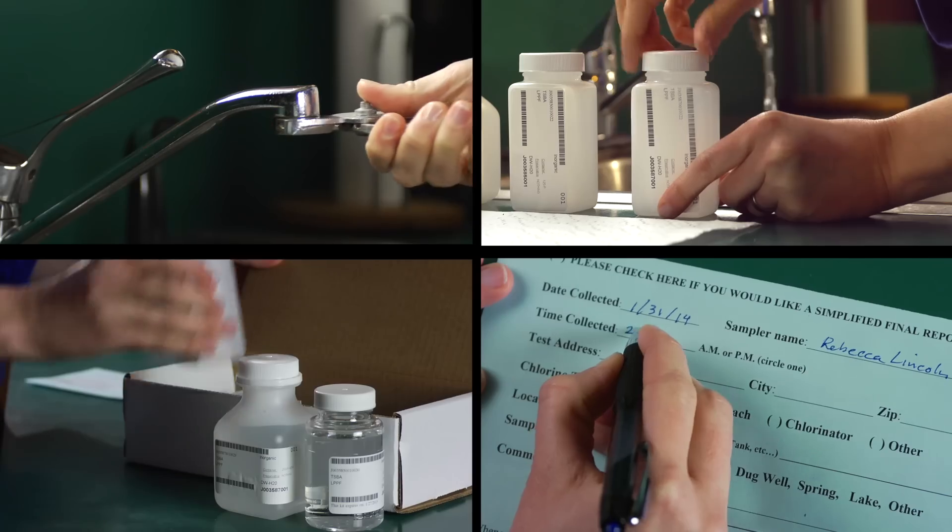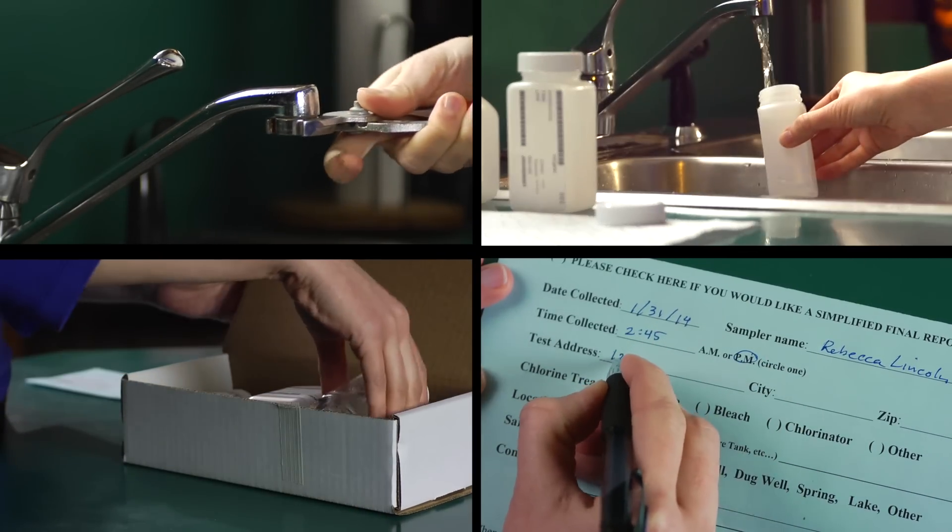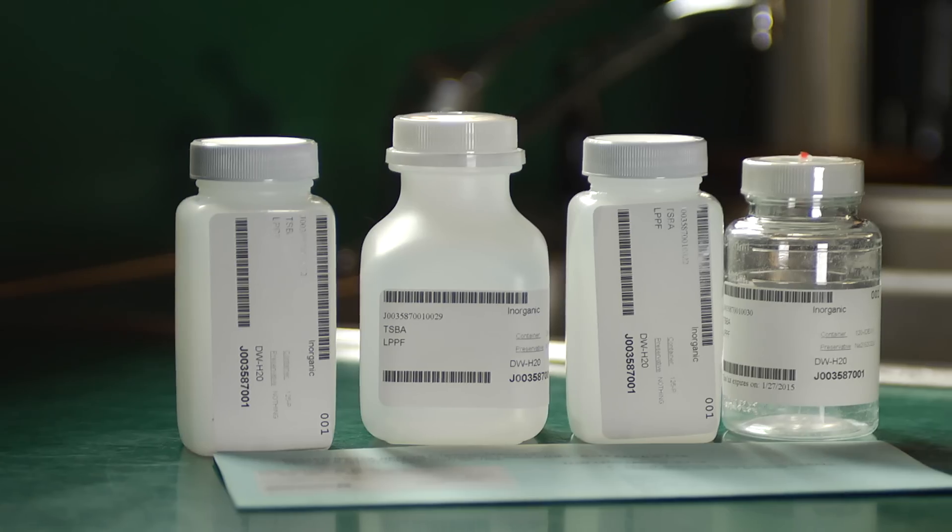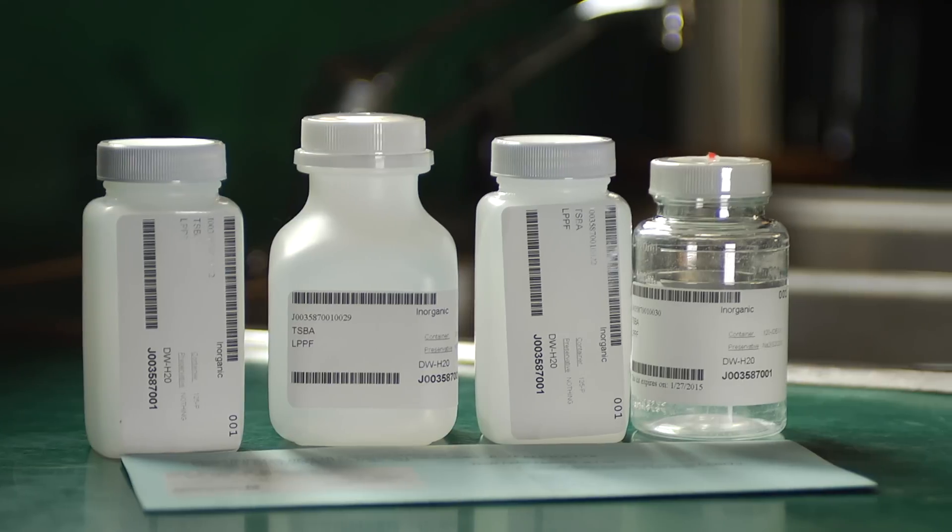This video will show you how to test your water, but be sure to carefully follow the directions that come with your kit as it may be slightly different. I'll be using a test kit similar to one you could order from any lab certified to test private well water in Maine.